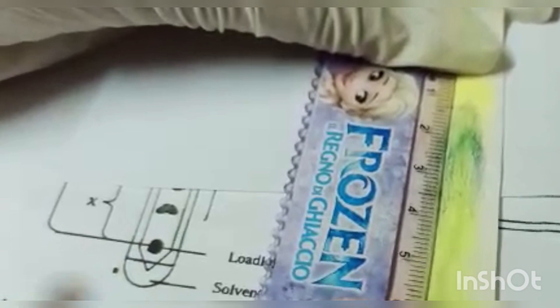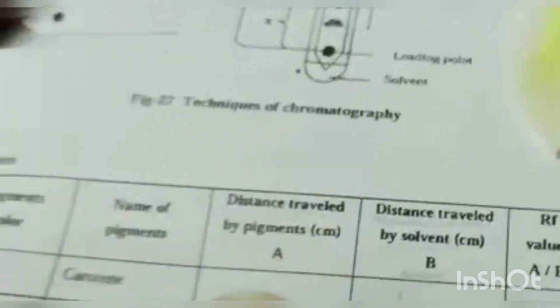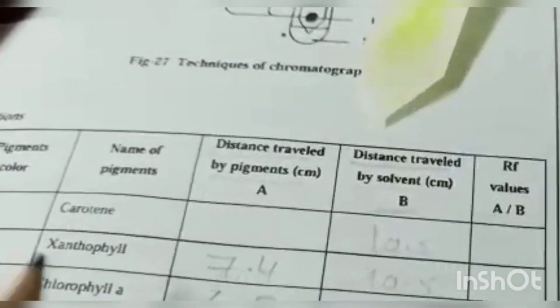The blue-green or dark green color at 6.3 centimeters indicates chlorophyll a. After that, we see the yellow color which indicates xanthophyll. We mark and measure the xanthophyll exactly from the loading mark — it is 7.4 centimeters. There is no carotene band because we have used spinach pigment.